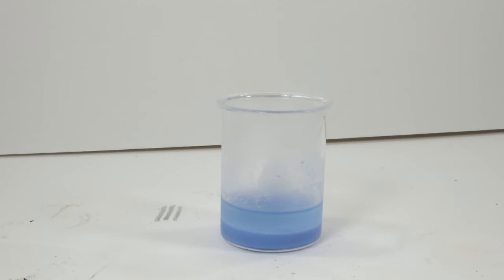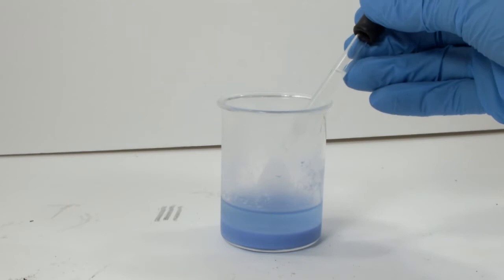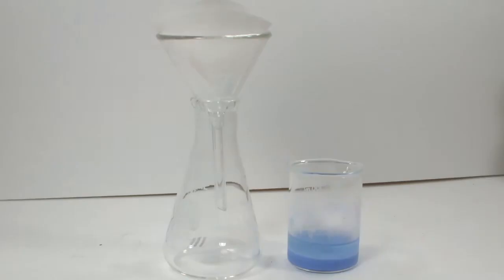Here's the sulfate complex after spending the night in the fridge. I add a few drops of acetone to make sure there's no further precipitate formation. And there isn't. So it's ready to filter now.